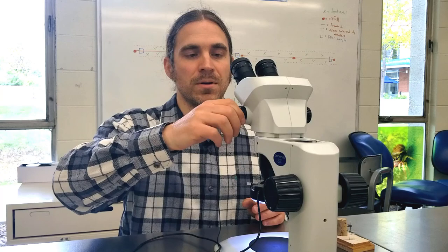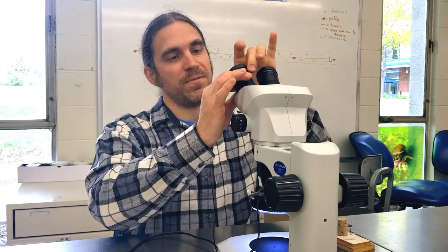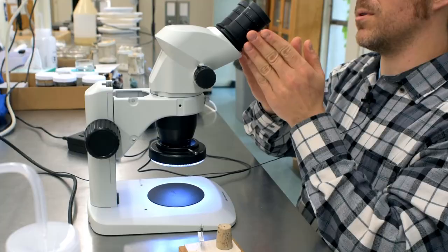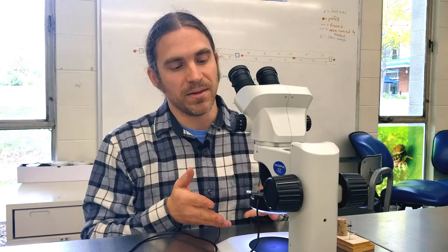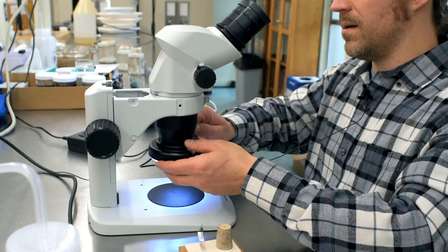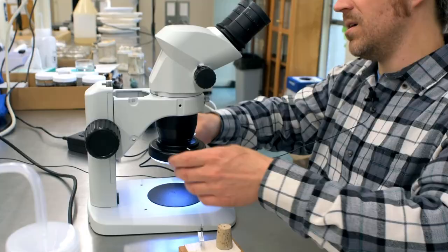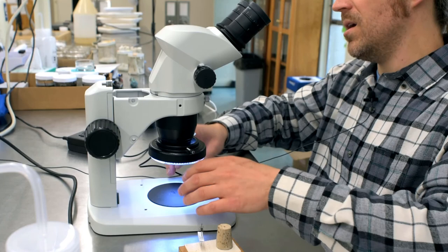Like the other microscope, the eyepieces on this can adjust. Unlike the other microscope, both eyepieces here have a fine focus on the eyepieces themselves — so if one eyepiece is out of focus, you can just adjust that one directly. Also, this microscope has an adjustable ring light. You can remove and reposition it, though you generally won't need to. It is a full ring light, so unlike the other microscope where light comes from one direction, you get a fully illuminated specimen with very few shadows, which is often quite nice.